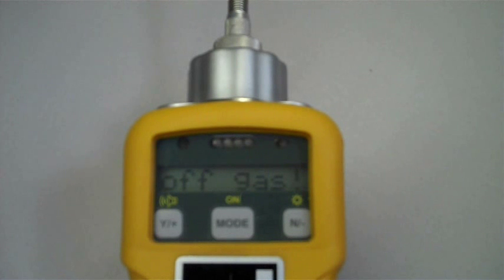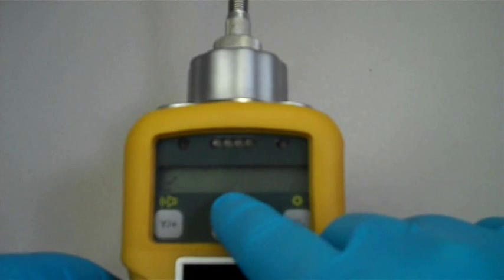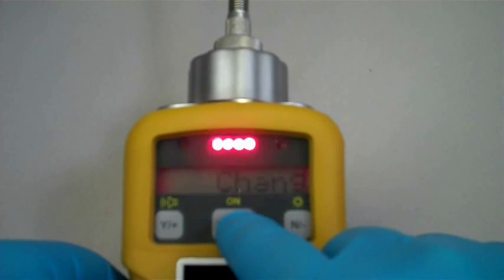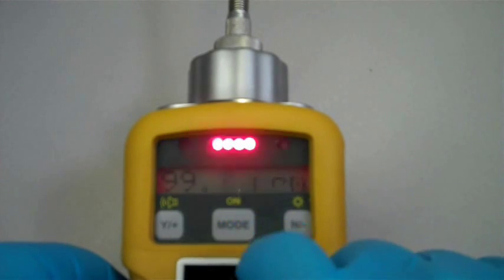We recommend that you keep the bag connected for a functional bump test. The bump test will ensure that the calibration was successful. With the Tedlar bag still connected, press the Y button once and then press the Y button again to go to the main display.